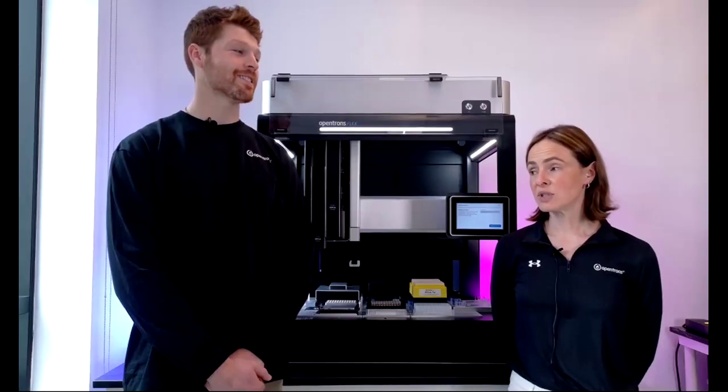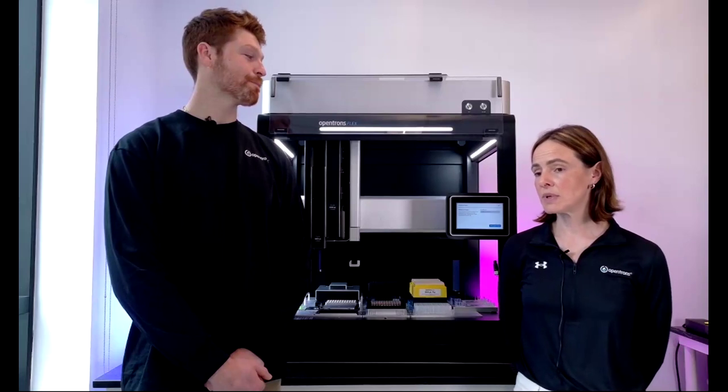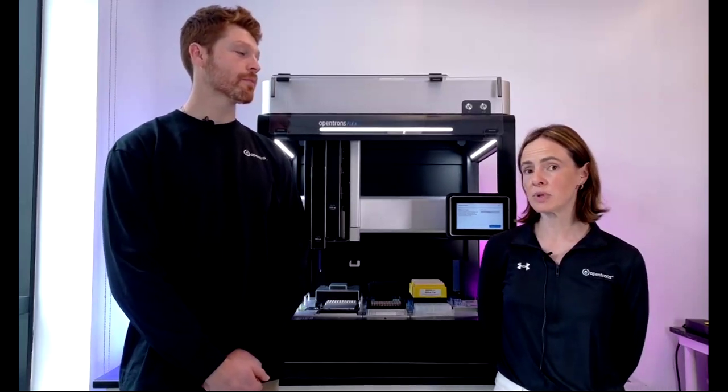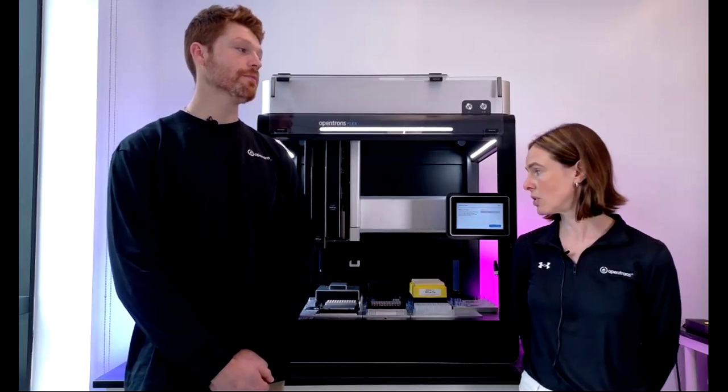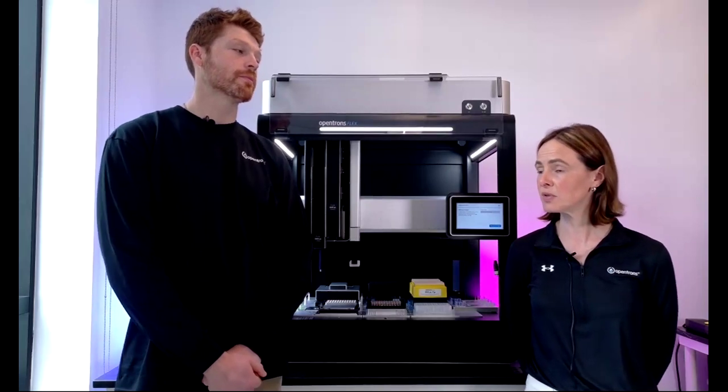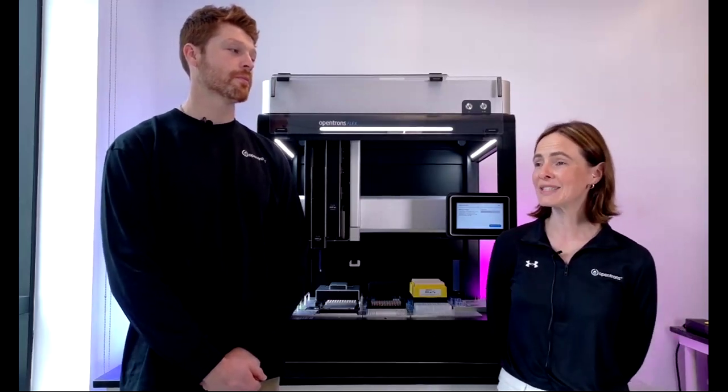Great. I'm going to pronounce this poorly, I apologize. Kisenija: when we're using the same protocol and materials, how often should we recheck calibration or position? That's a great question, actually. I would say it's very user dependent. Some people like to do their positional calibration after every run or two, and others do it once a month or less.